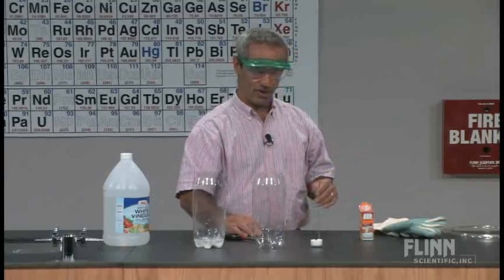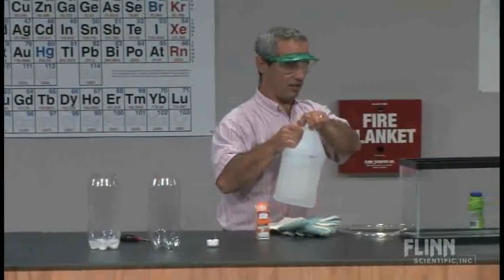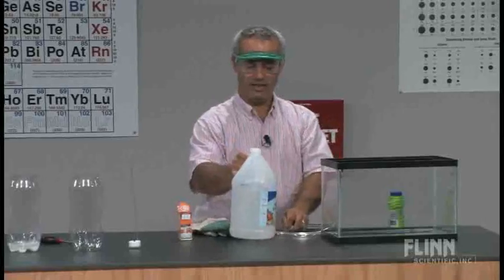Now I've got a similar demonstration I'm going to do over here and come back to this just to illustrate how dense the carbon dioxide is.